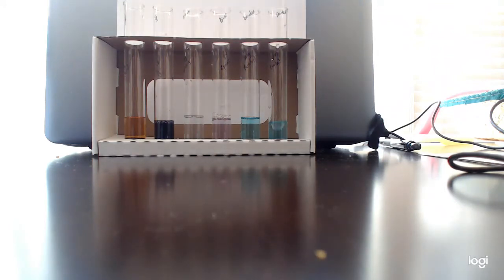Counting the drops: 1, 2, 3... 24. Too many. Okay, sorry. So we've added the glucose solution to that. But you can see that there is no color change that takes place. This is because this particular reaction requires a little bit of heat.